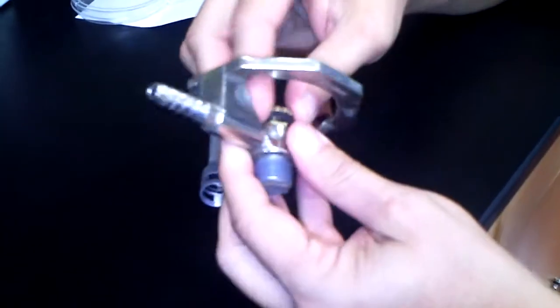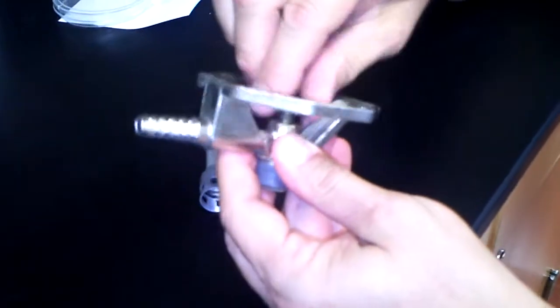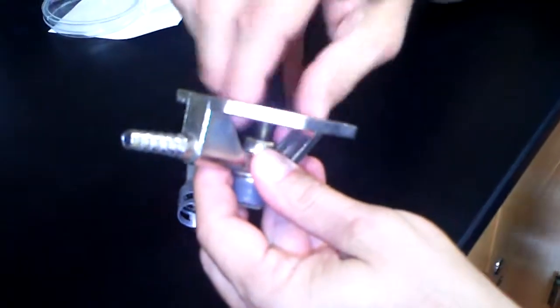You can also take off the valve underneath the base. This is where it controls the gas that comes into the Bunsen burner.